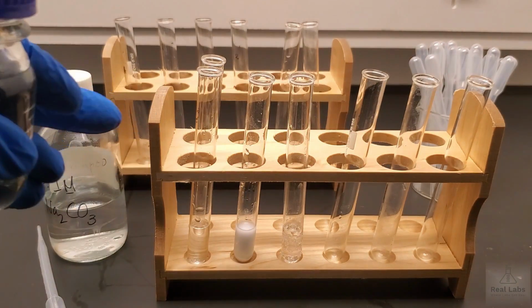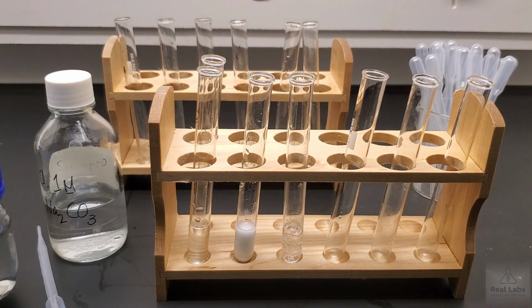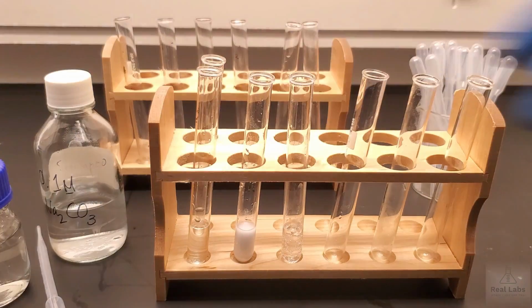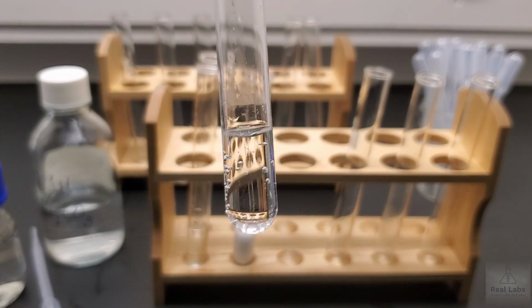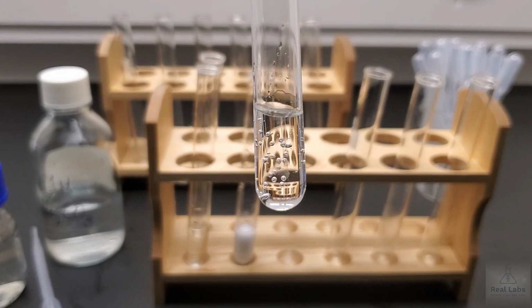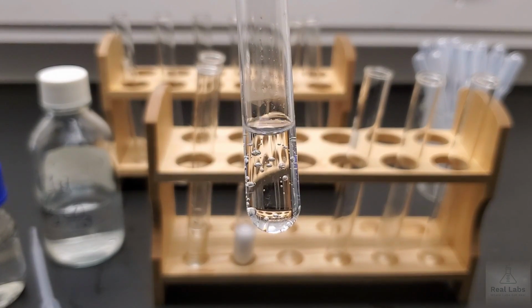So even though we didn't see any physical reaction there, no solid was formed, it did look like there were bubbles formed. That wasn't just from the mix. So if we look a little closer at that, those bubbles have held. So that tells you those bubbles were probably formed during the mixing of that system.